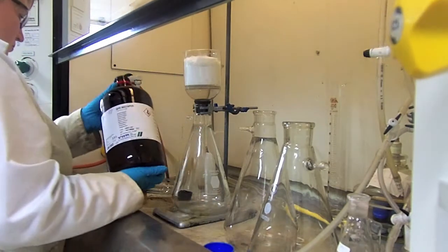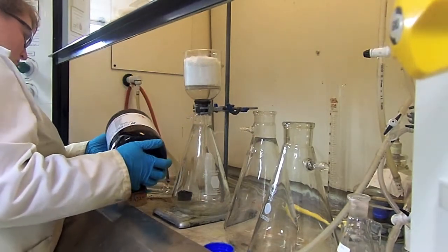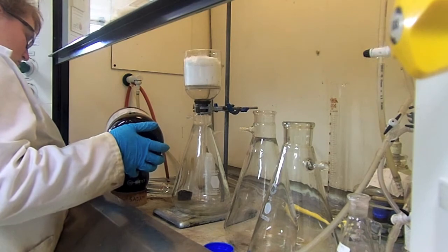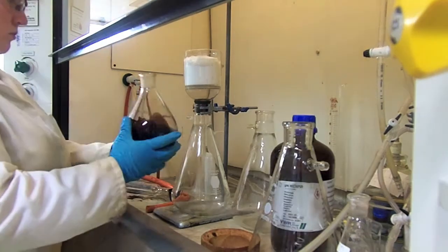Fully dissolve your porphyrin in a minimum amount of a suitable solvent. In this case we're using dichloromethane. Use sonication if necessary to get the porphyrin dissolved.